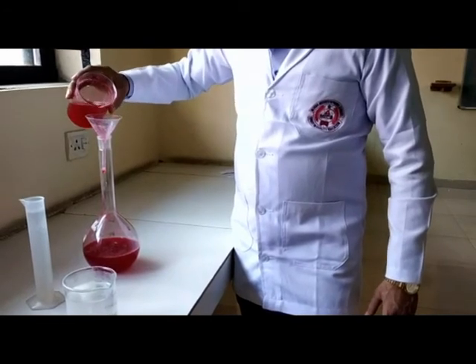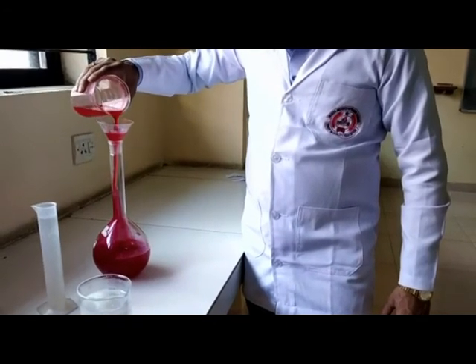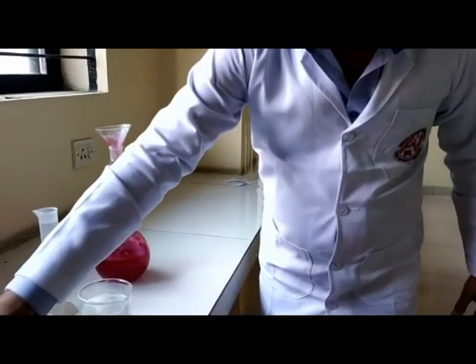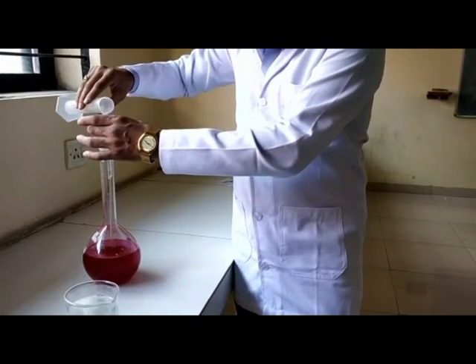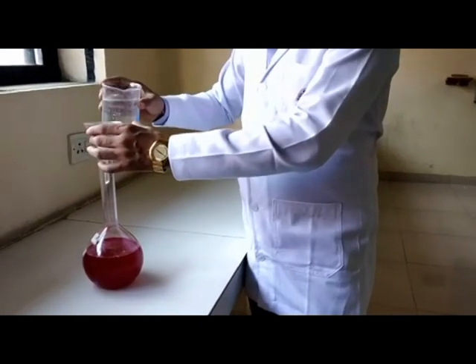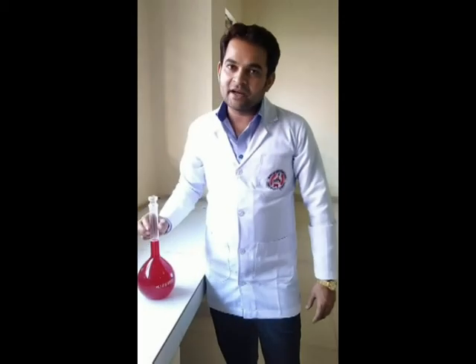The above prepared solution is transferred into a volumetric flask. The remaining invert syrup is added to the preparation, and the final volume is adjusted using glycerol up to 1000 ml. This completes the preparation of 1000 ml of pediatric paracetamol elixir BP.